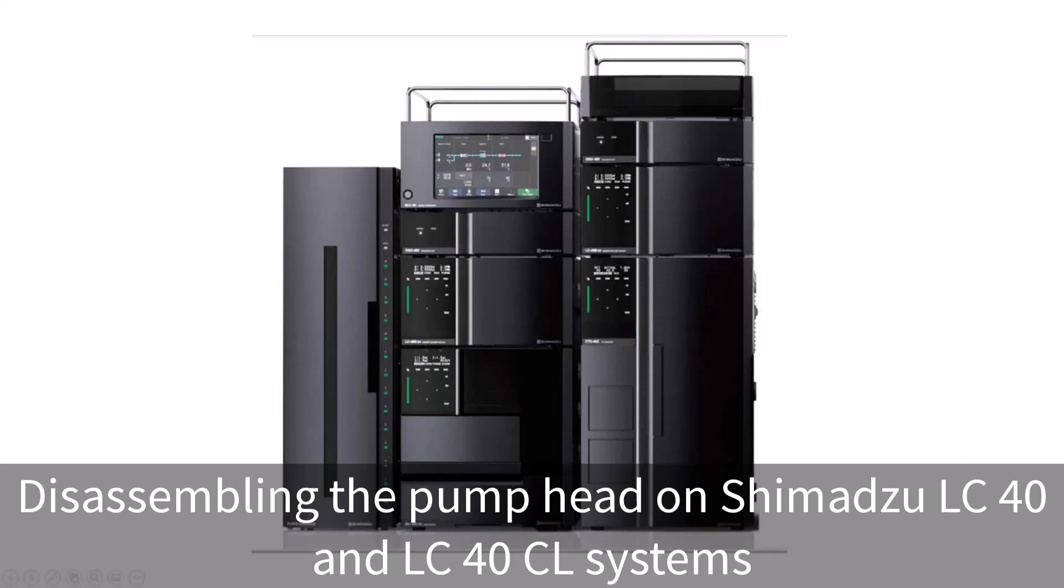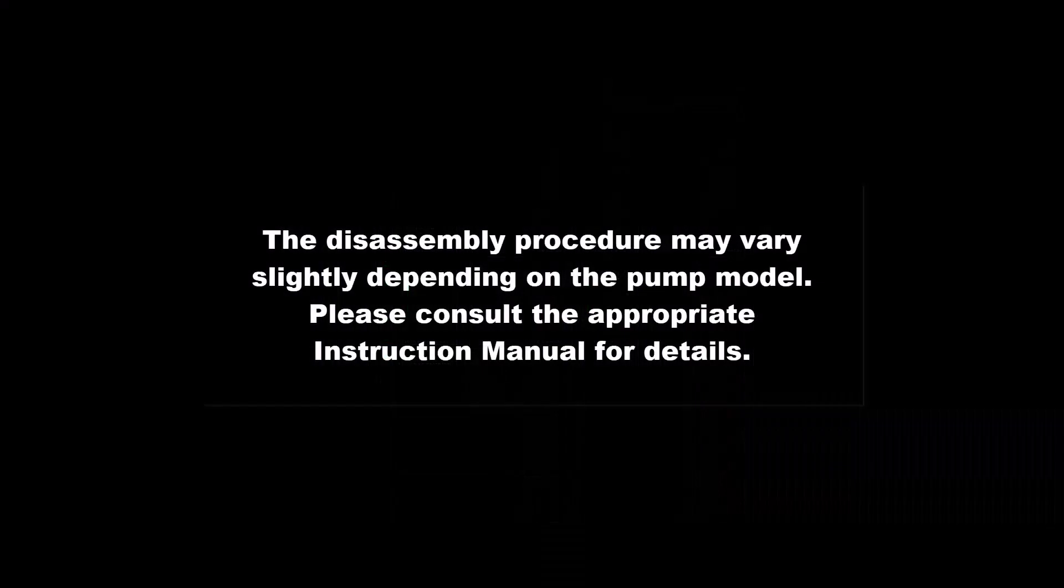In this video, we'll show you how to disassemble the pump head on Shimadzu LC40 and LC40CL systems. Before beginning the disassembly, please consult the appropriate instruction manual.